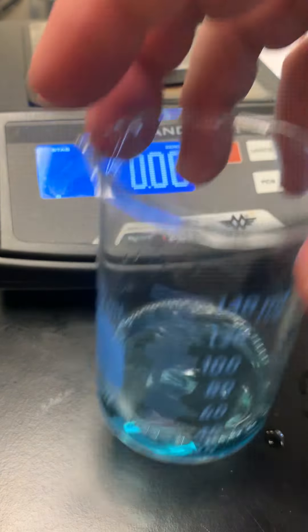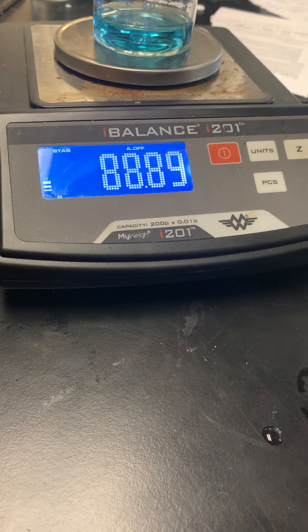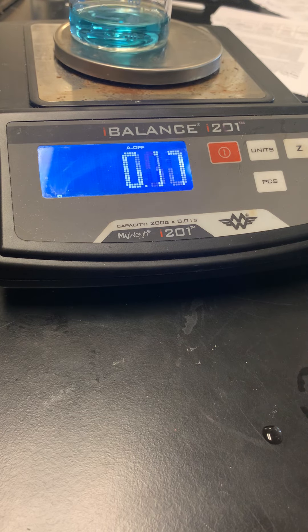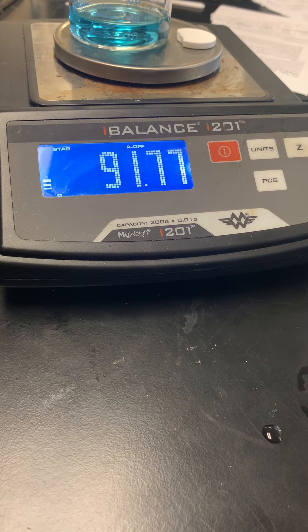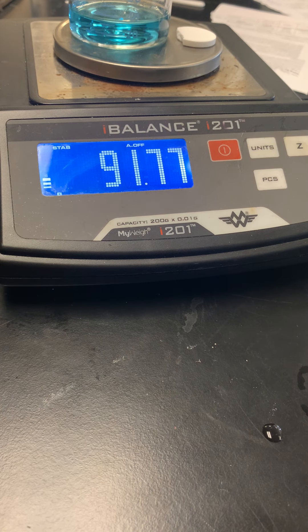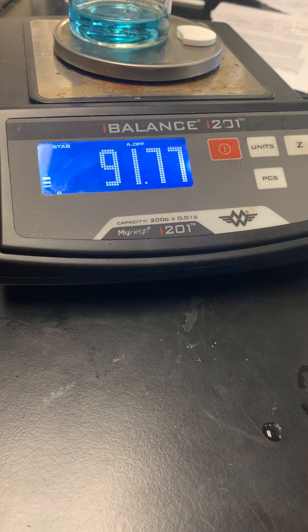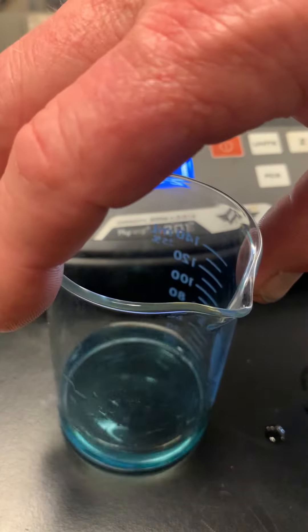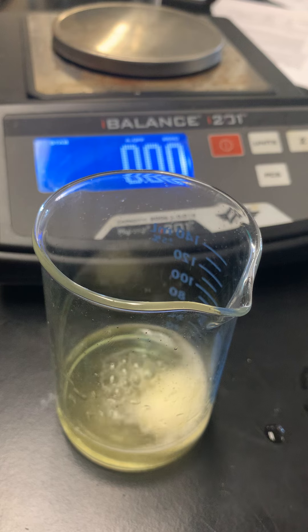We can write observations about the mass moving from 67 up to 88.89g. We take a tablet — I only have a portion of a tablet, but that's okay. On your data table, record the mass of the beaker with BTB, then the mass of the beaker plus water. Then we'll add the tablet and watch the reaction take place.